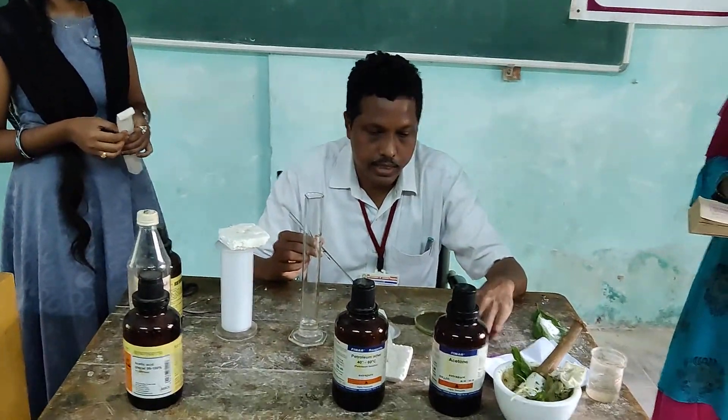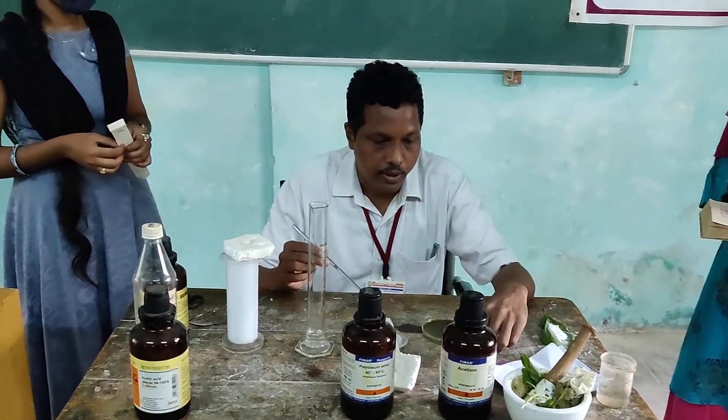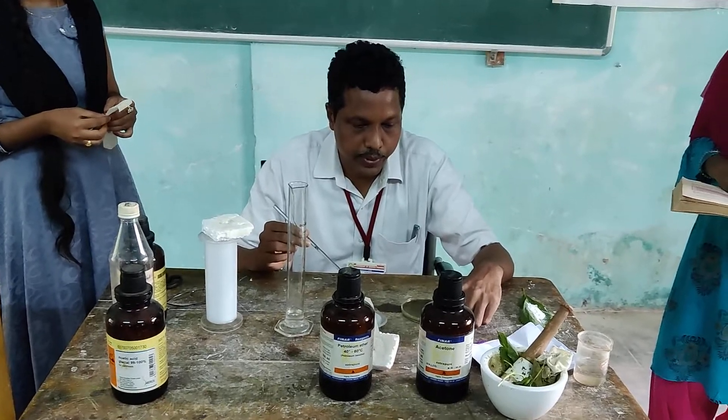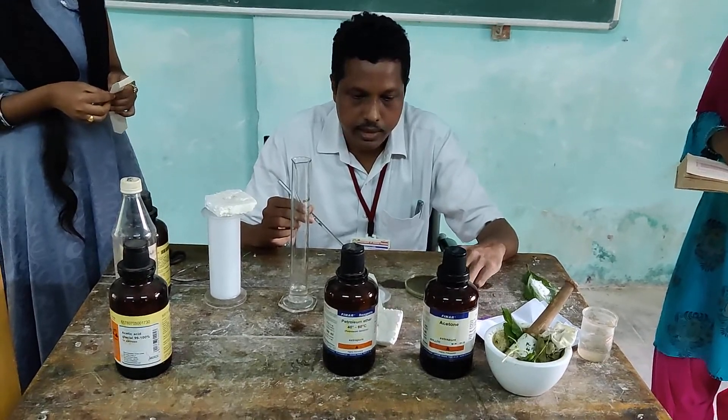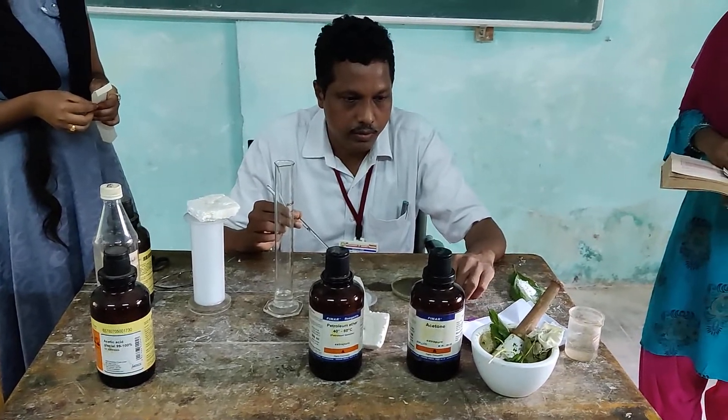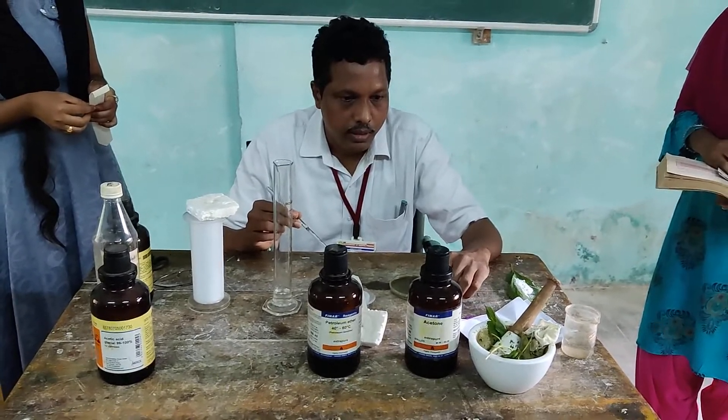Dear students, in this chromatography experiment, we will cover the preparation of materials, apparatus, and chemicals.